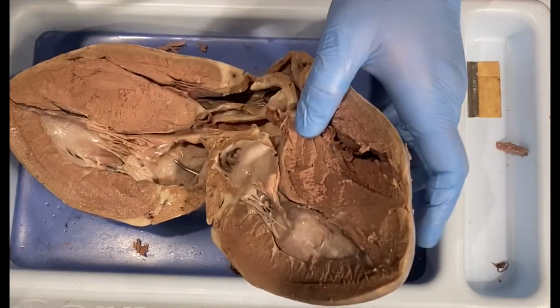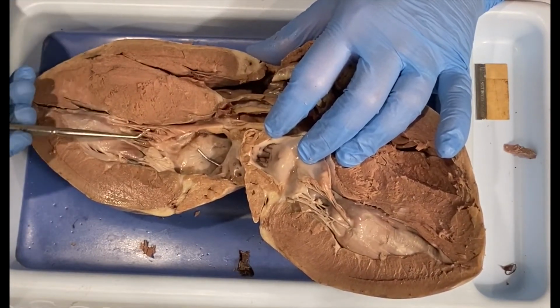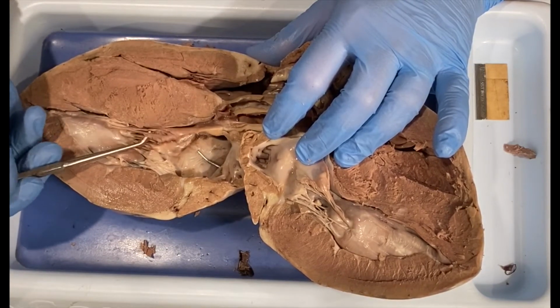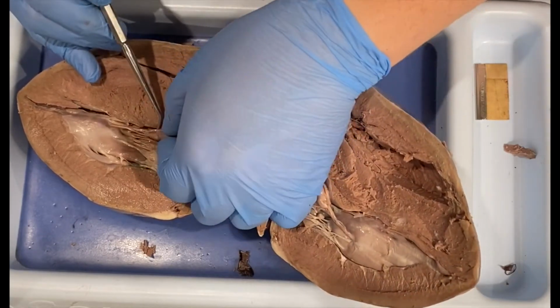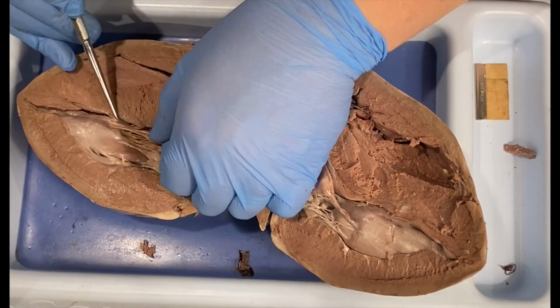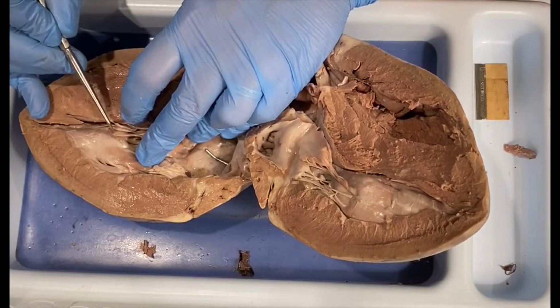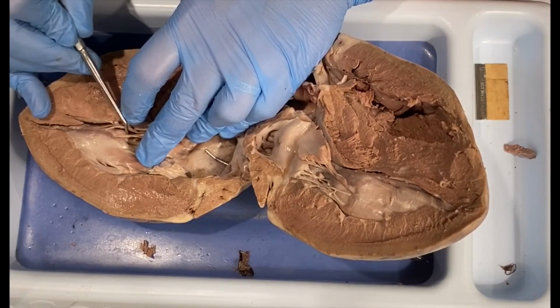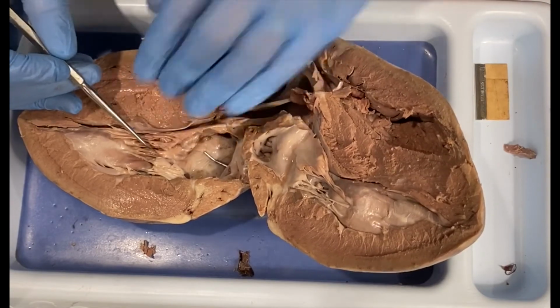So the other structures that I wanted to point out to you are these really fascinating cords. It's basically tendon type material, and this is referred to as the chordae tendineae. This is what actually holds the valves in place and allows them to do their job. And where they connect, these little areas are called papillary muscle. Basically, it is just a little protrusion that they connect to. And these cords are what are controlling the valves.